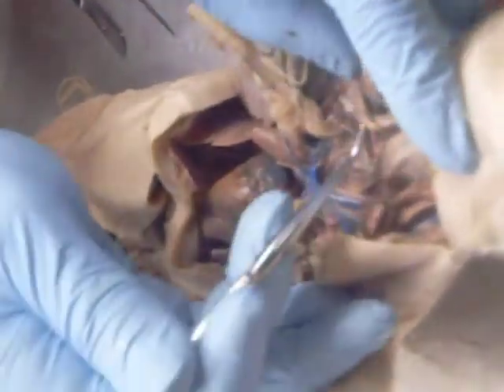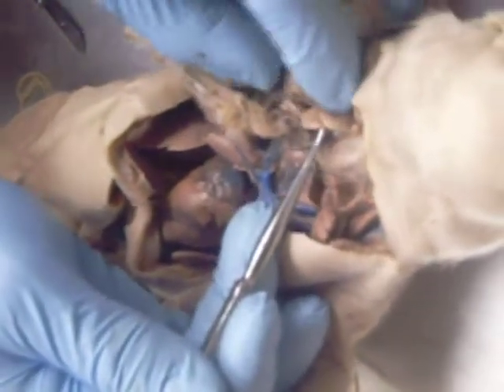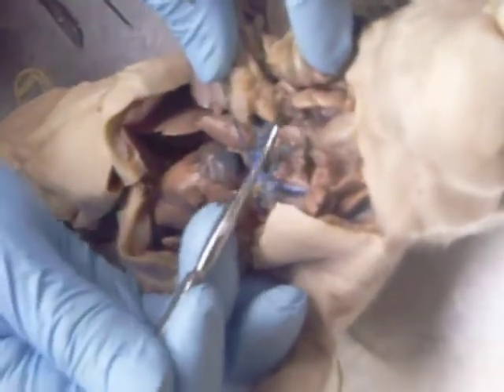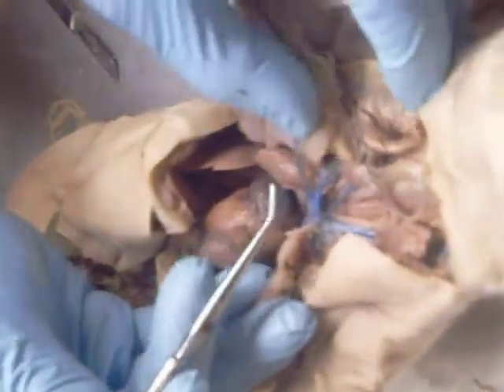Okay. In terms of other things here, this would be the thymus. That's all thymus on both sides. That's the thyroid right there. That's the trachea. The bulb is the larynx. Underneath here is the esophagus, so I'm pulling the esophagus forward there. That's most of what I would ask in this region.